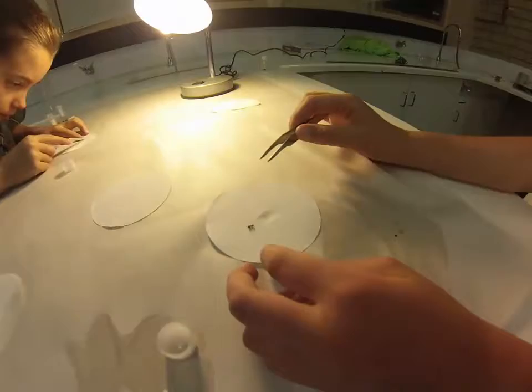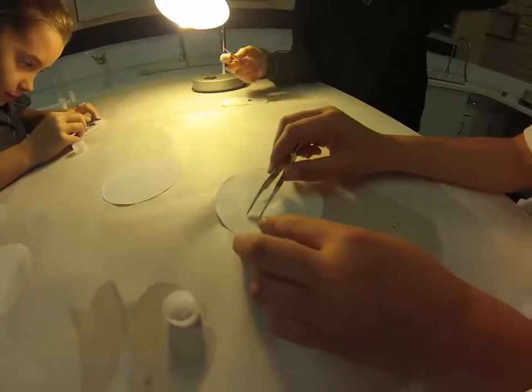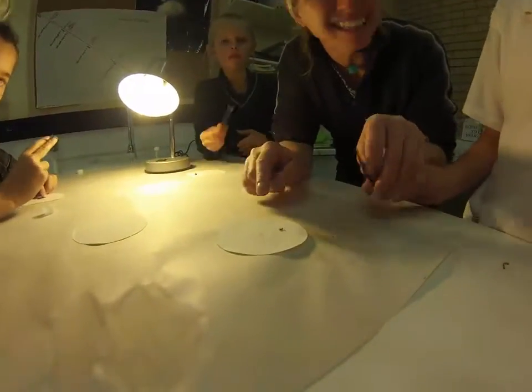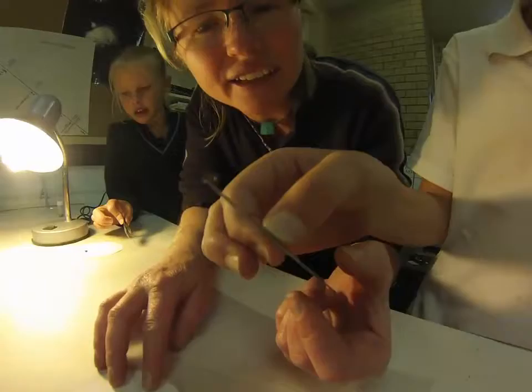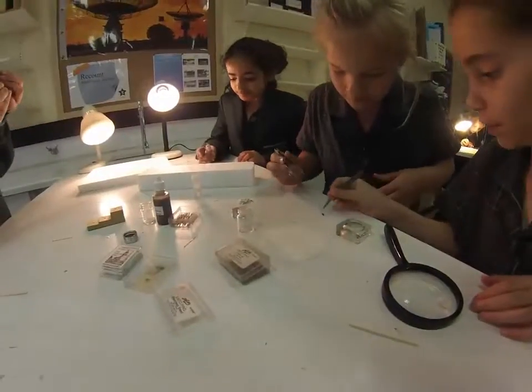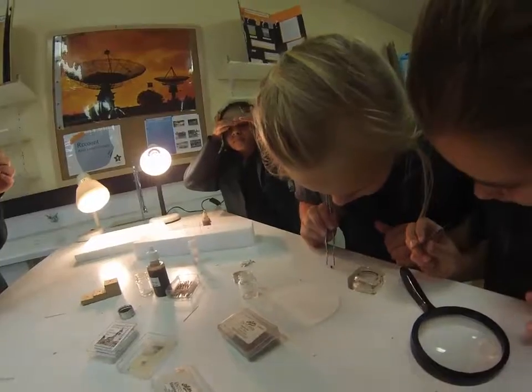This looks interesting. It's very hard — yes it is. If you've already got its legs out and it's looking good for pinning, just grab it up by one leg like that. Don't push too hard, be careful. Don't break the leg. Get one of the antennae — don't grab the body, otherwise you'll squish it.